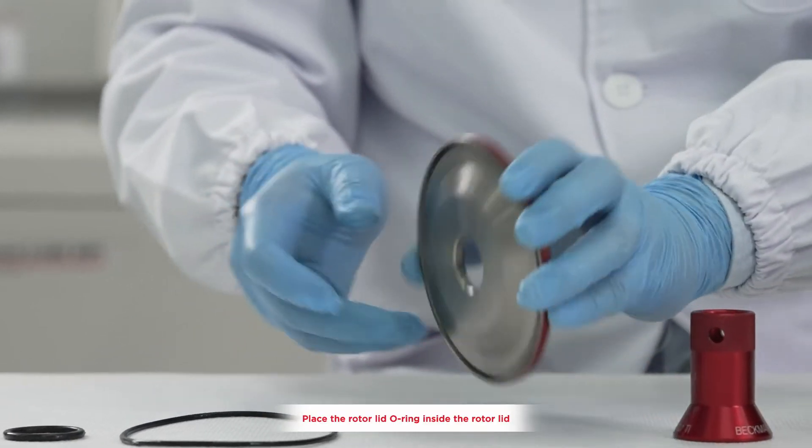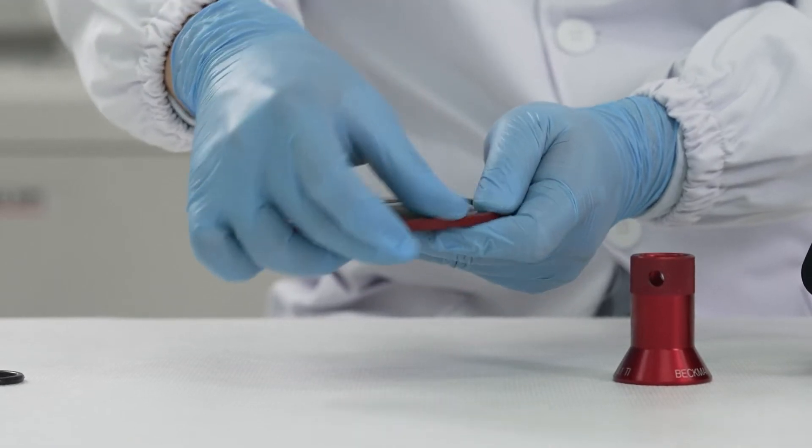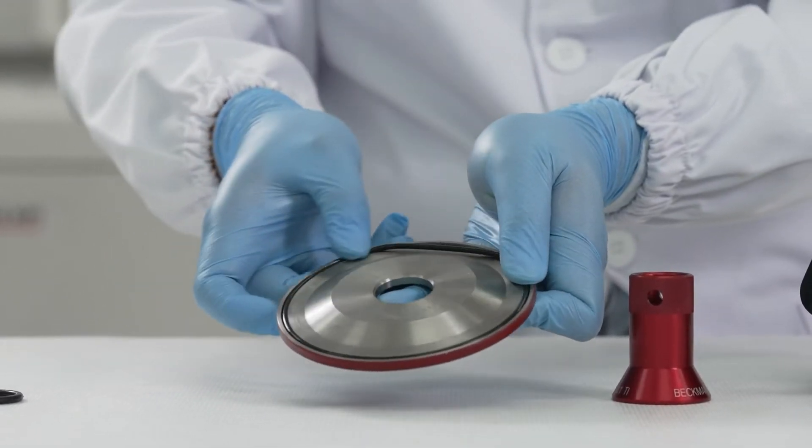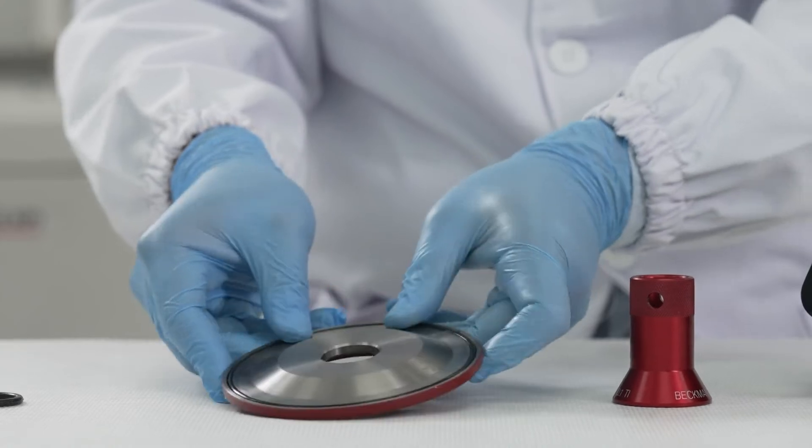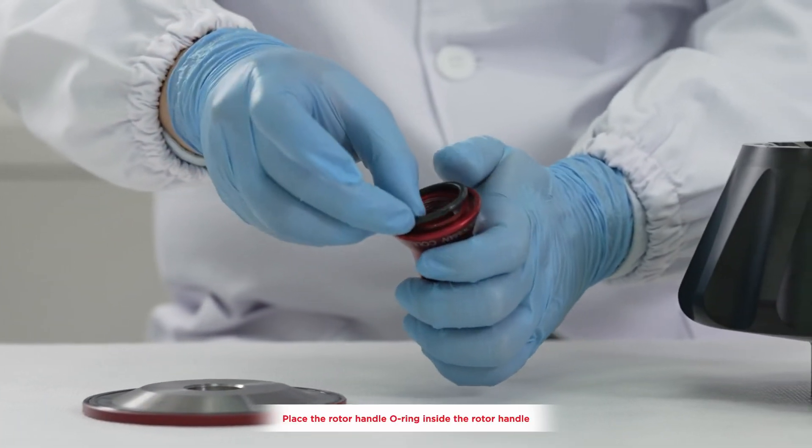Place the rotor lid o-ring inside the rotor lid. Place the handle o-ring inside the rotor handle.